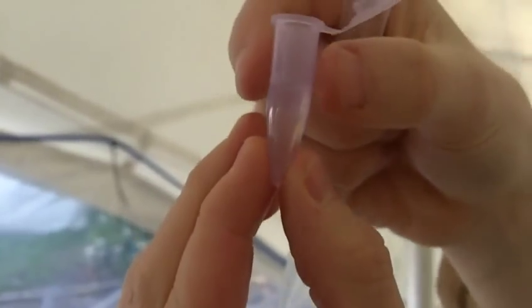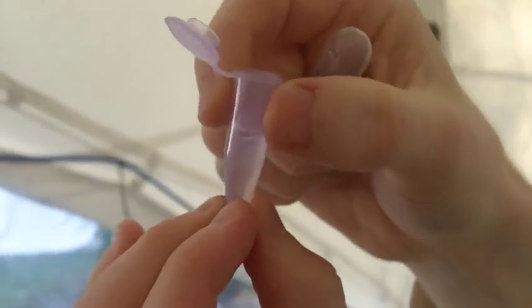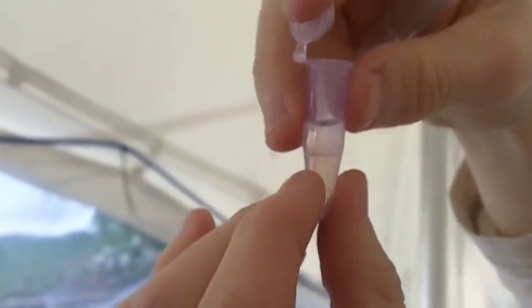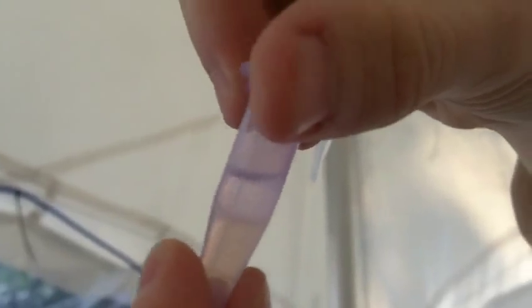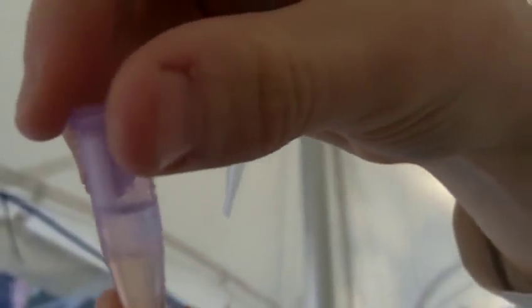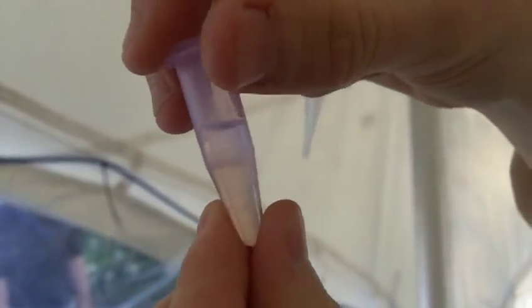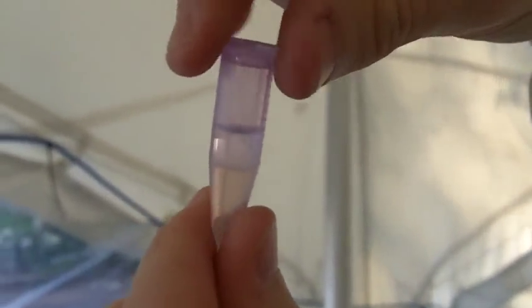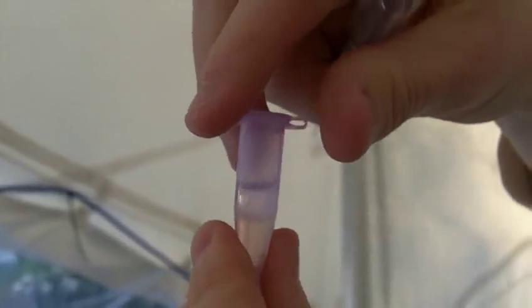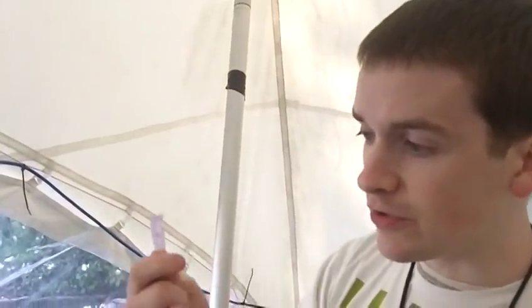Here's my IPA — isopropyl alcohol. You can get 70% isopropyl alcohol from a pharmacy; you can also get 100% from chemistry supply shops online. This is the DNA I just took out — we'll see if we have any luck. Now it's going to be kind of hard to see, but I believe you're beginning to see in the middle there an interface forming of cloudy white material. That cloudy white material is the DNA and any remaining contaminants — as the DNA falls into the isopropyl where it's insoluble, it just falls out and becomes visible as it diffracts the light.